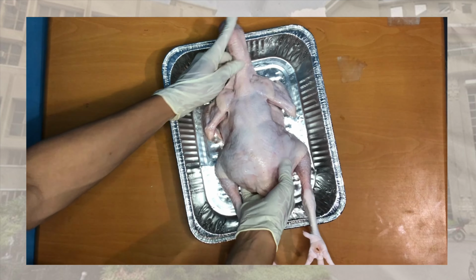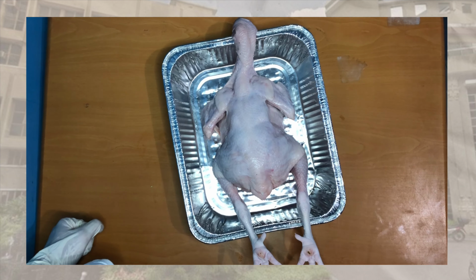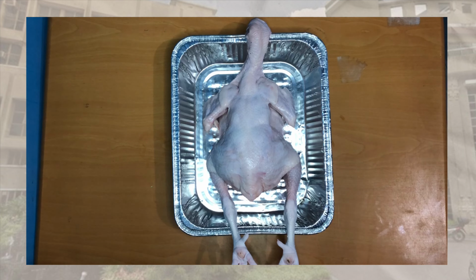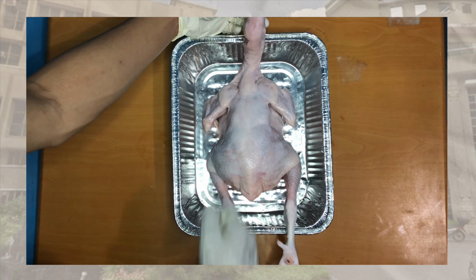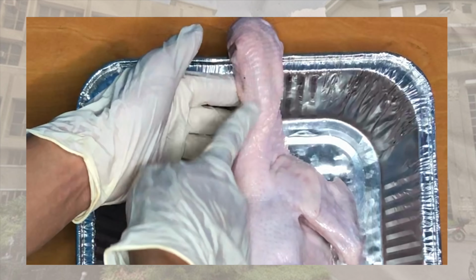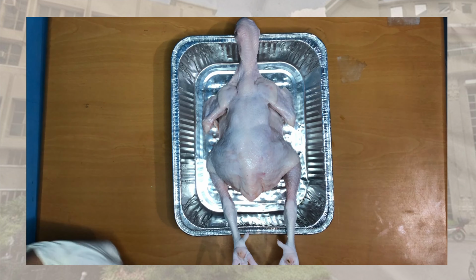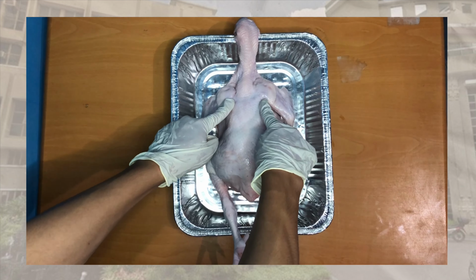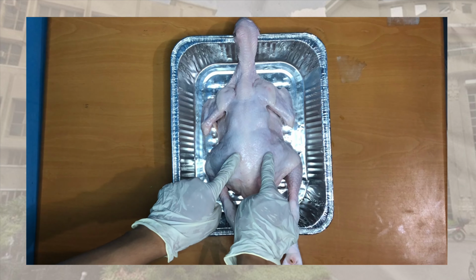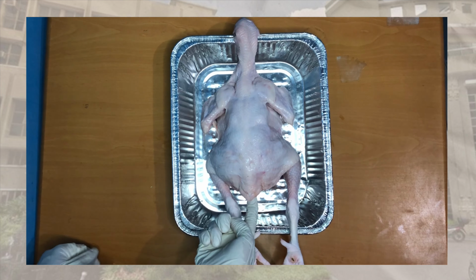The practitioners turn the patient's body into a posterior position to examine its body parts. Under cephalic, here is the occipital, which is also known as the back of the head. Here is the cervical. Under the dorsal part, here are the scapular, vertebral, lumbar, sacral, and gluteal.